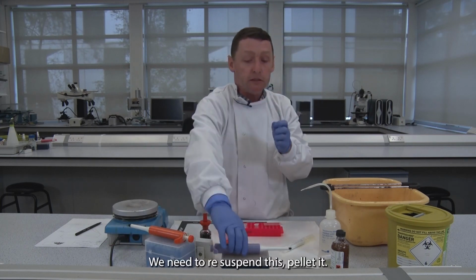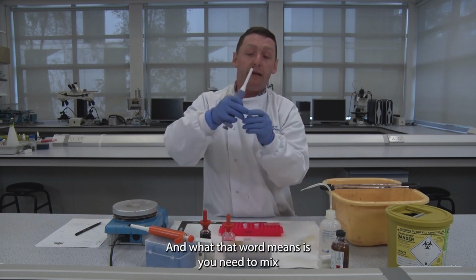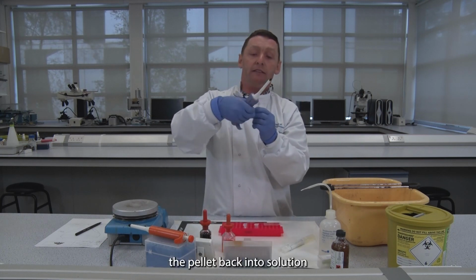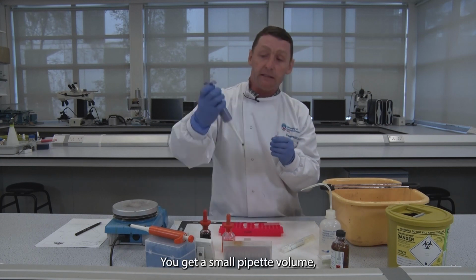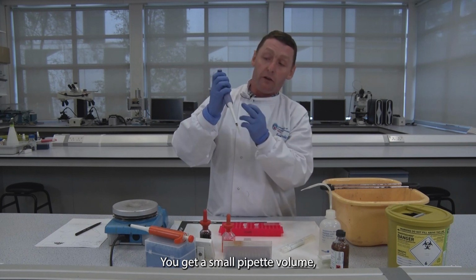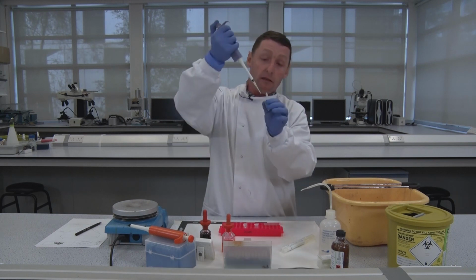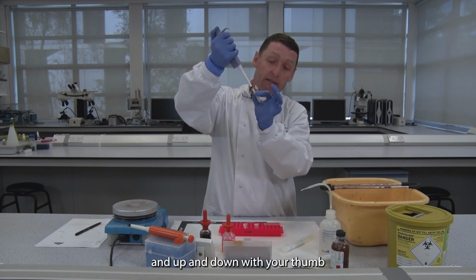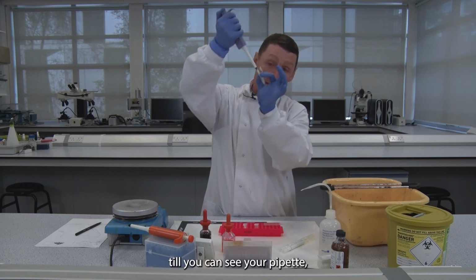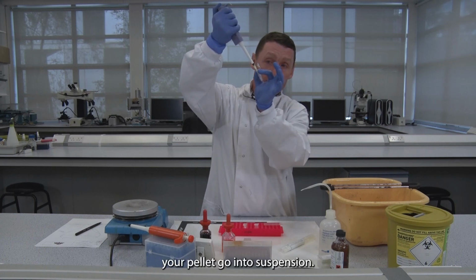We need to resuspend this pellet, and what that word means is you need to mix the pellet back into solution. How you do that: you get a small pipette volume, probably about a P200 pipette, and you put your pipette tip in the solution and go up and down with your thumb till you can see your pellet go into suspension.